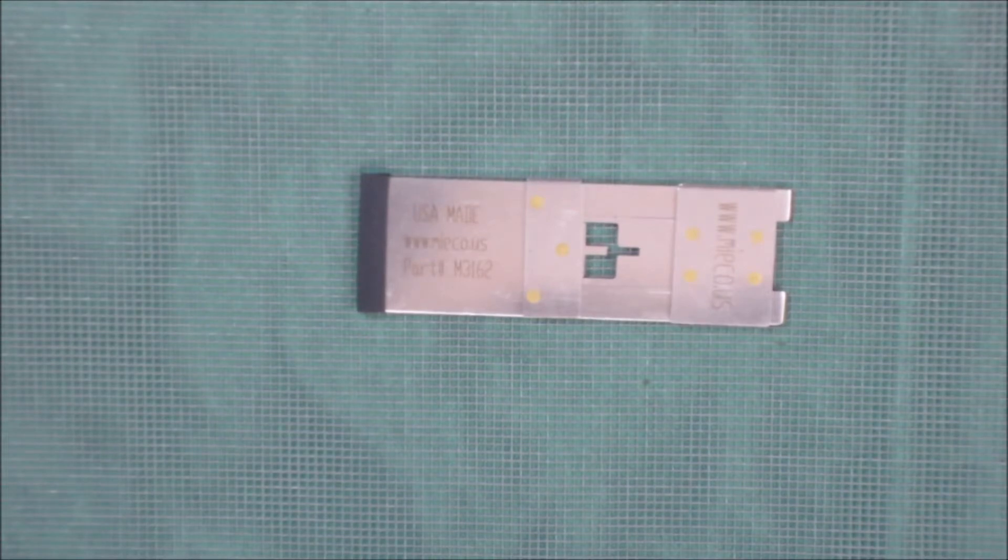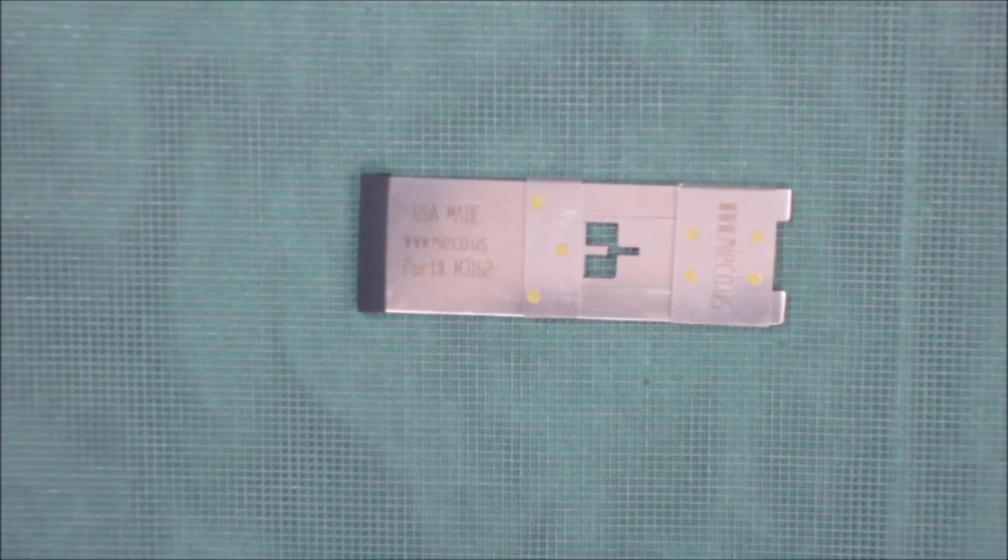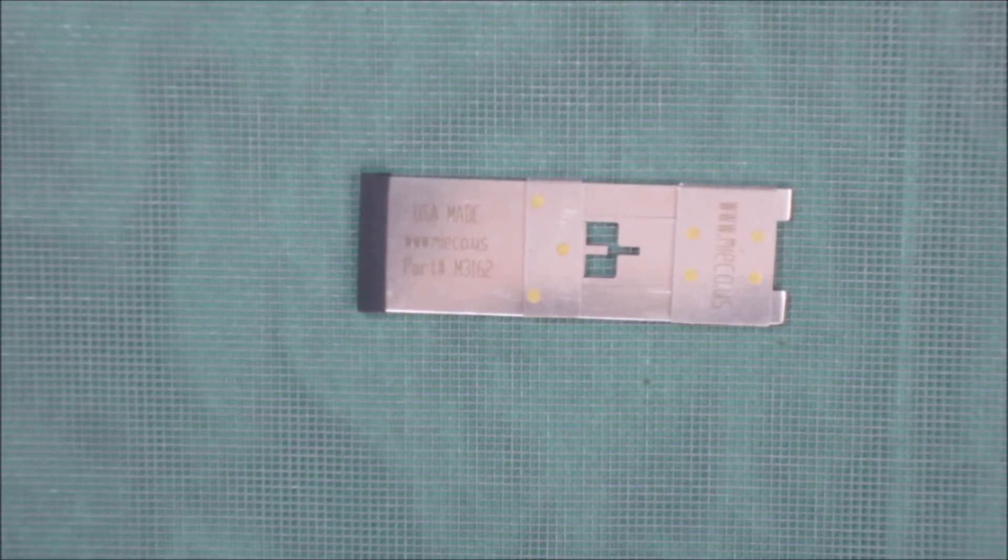I have a lot of limitations with the microscope I have. It's a very inexpensive microscope. It's still good for my needs. The people that normally use these things have microscopes ranging in the thousands of dollars. This is a couple hundred dollars, a few hundred dollars.